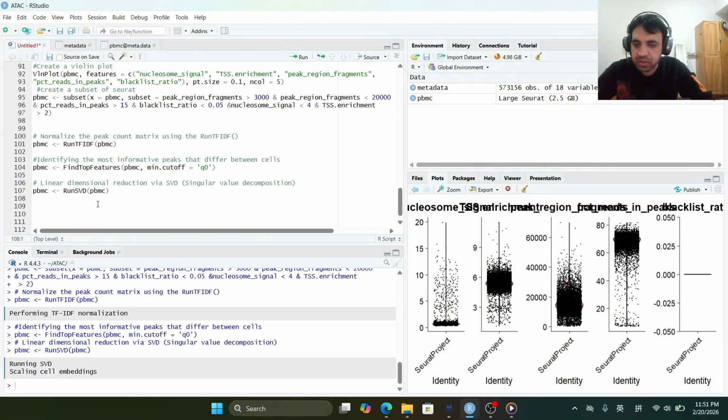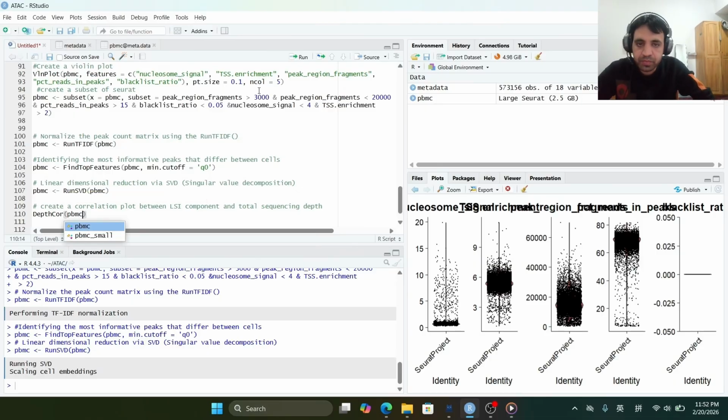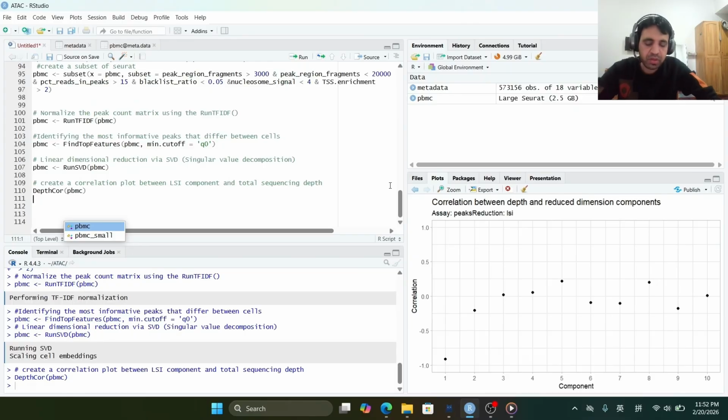Finally, the SVD dimensional reduction has been completed, and now we will make a correlation plot between the LSI component and the total sequencing depth. So create a correlation plot between LSI component and total sequencing depth. So we will use the depth cor function from the Signac package, and pbmc, and run. You can see the correlation plot. The first LSI shows a strong correlation, and so we will remove that in our downstream analysis.